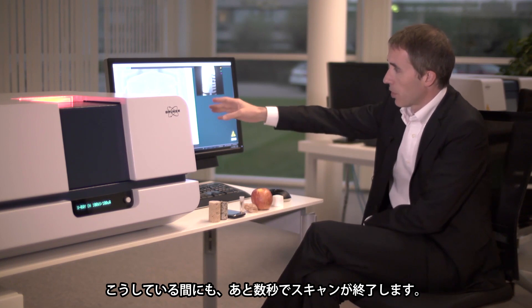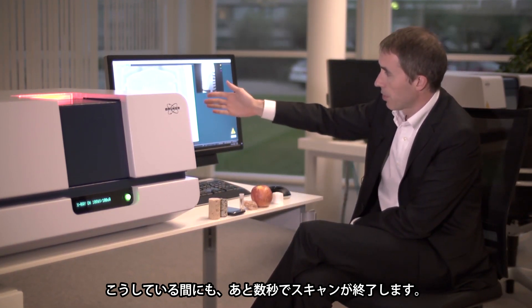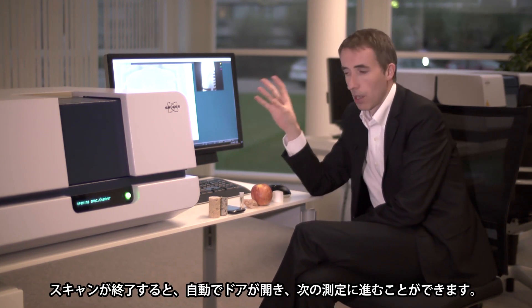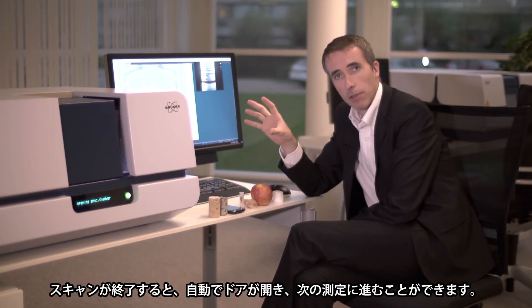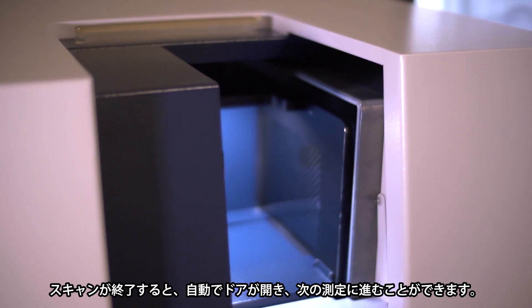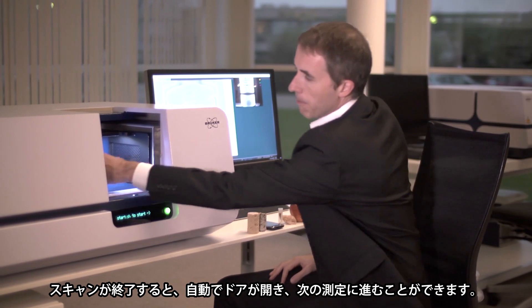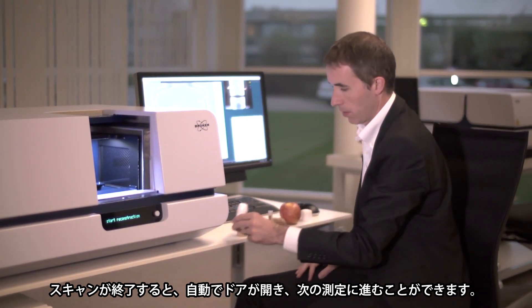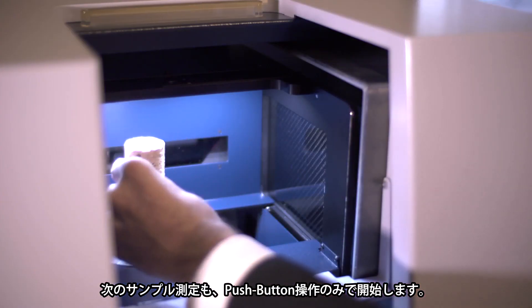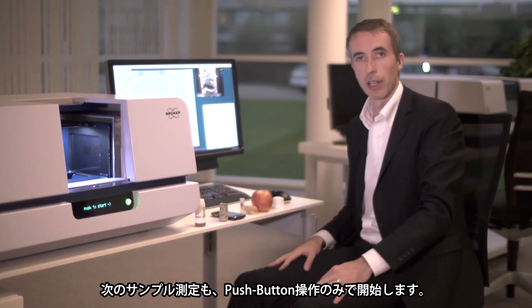At this point in time the scan is just finished, just a few seconds left, and as soon as the scan is finished it is ready to place in your next object. The object becomes available, you can just take it out, put your next object inside, and again with a single push of the button you can scan your next object.